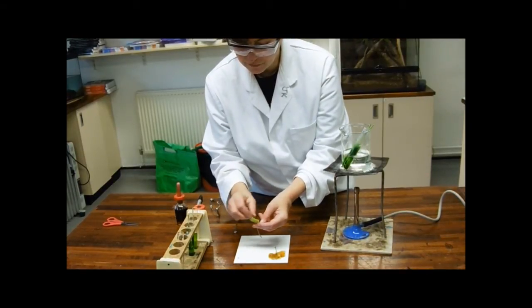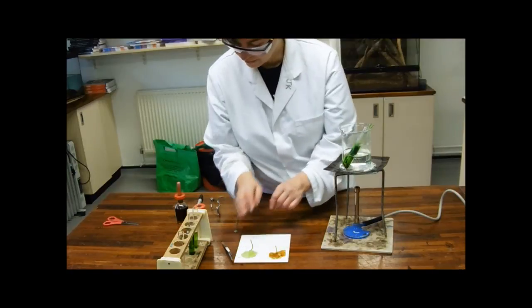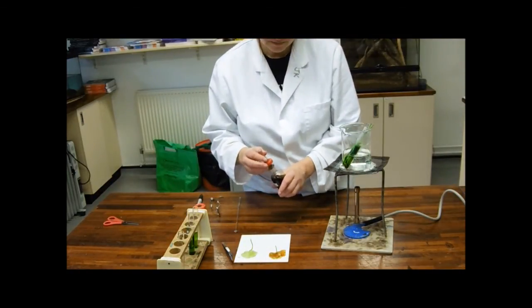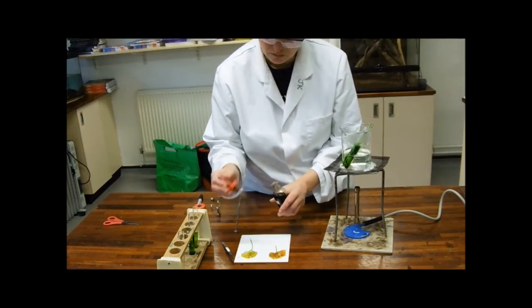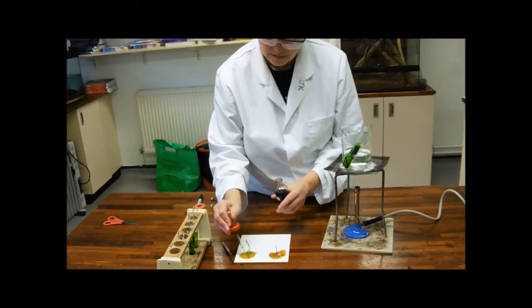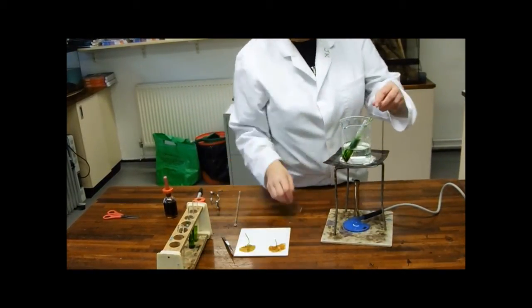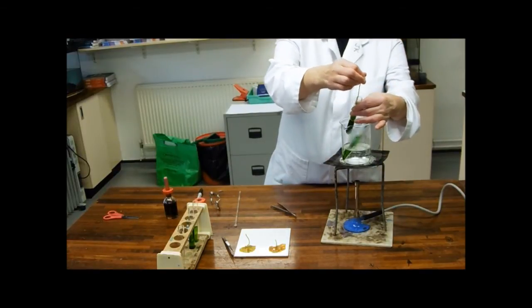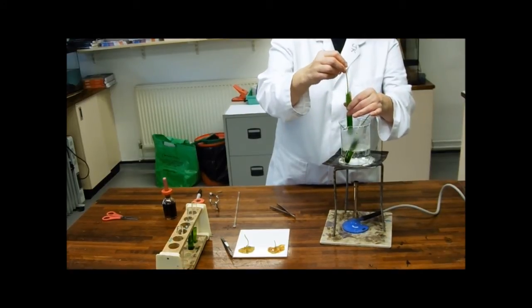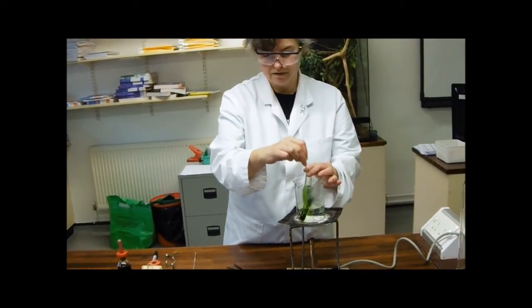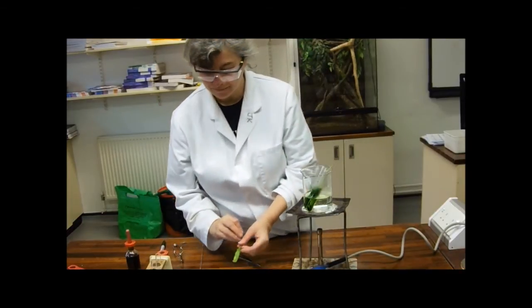Obviously, in an exam, you're not going to see photographs and videos of these things happening. They're going to be asking you questions about it. So, this one, this has been deprived of carbon dioxide. So I'm really not expecting this one to give me any blue-black at all. I'll tell you what's lovely about this experiment, that the ethanol boils, just because it's been popped into boiling water. It always fascinates me, that. It's even the best bit of chemistry.